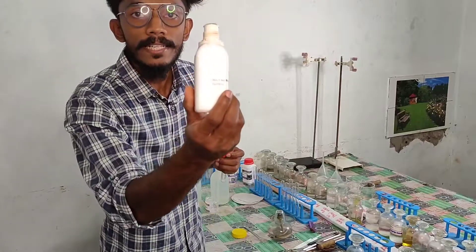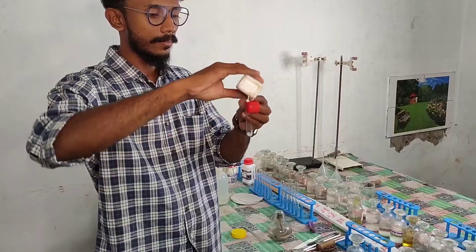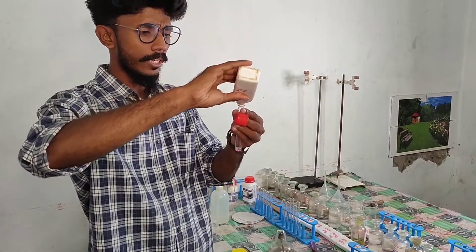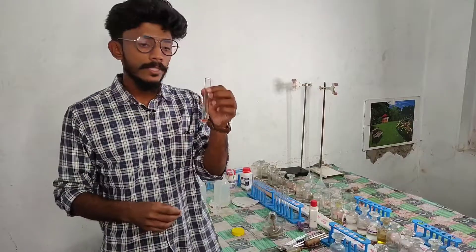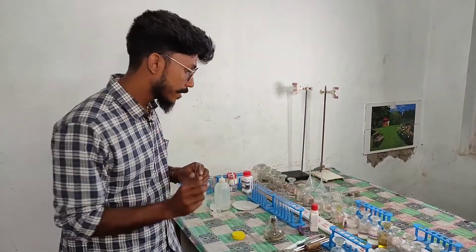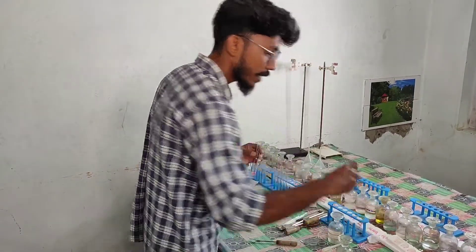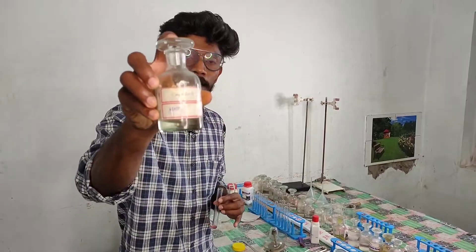In the test tube, we use a cobalt nitrate solution — two or three drops of cobalt nitrate. Then in the process, you use nitric acid. This is the nitric acid solution.